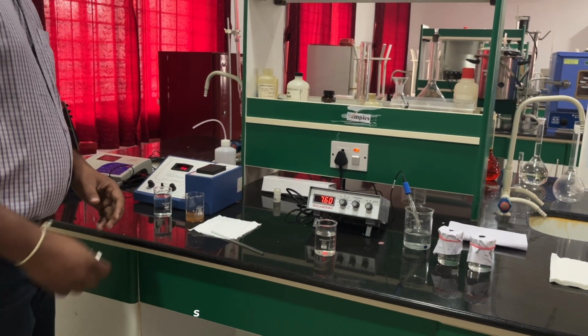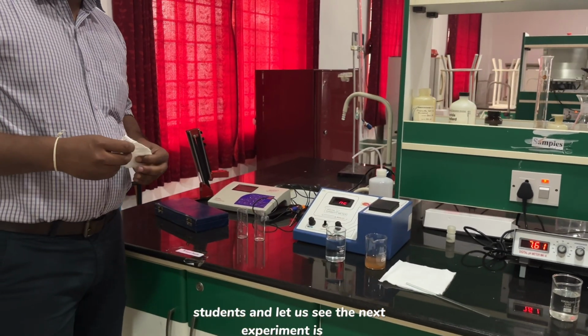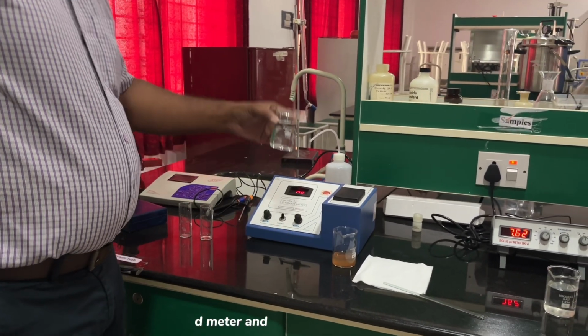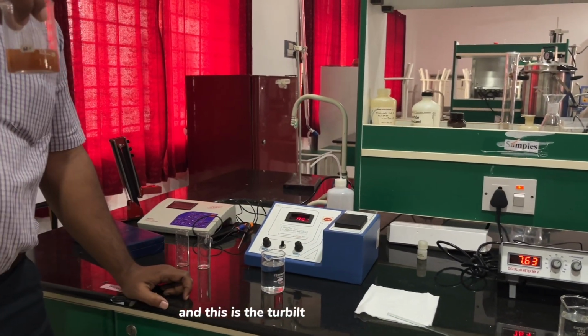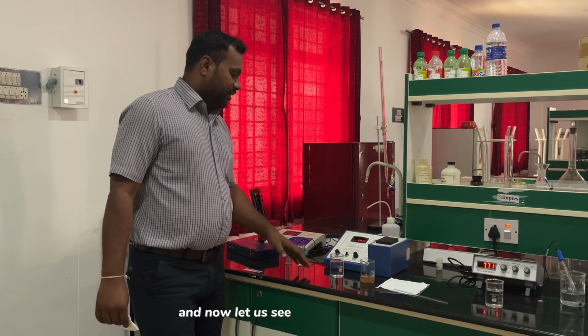Okay, students, the next experiment is turbidity. Here you can see the turbidity meter, this is the pure water, and this is the turbidity water. With the continuity of pH, now let us see the turbidity in the water.